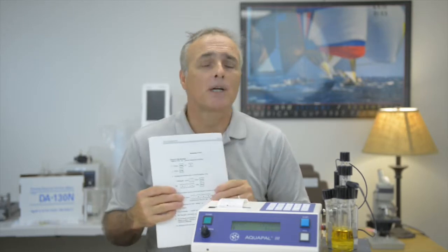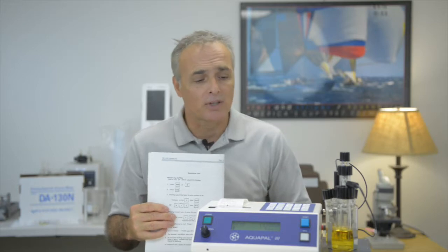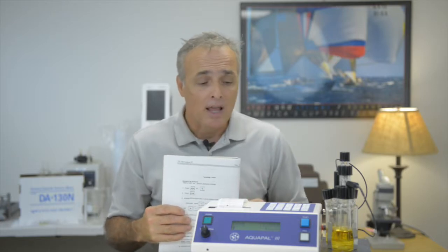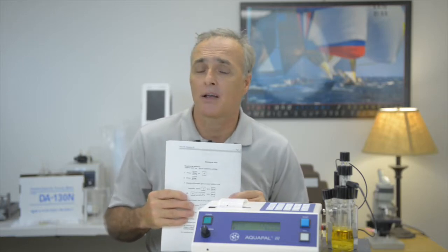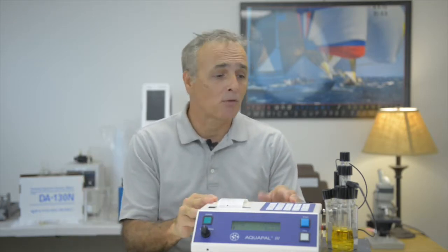I think one of the big questions that people have is, do we have to enter every time we run a test? Do we have to enter ppm or percent? And do we have to tell it its specific gravity? And do we have to put in the volume and so forth? What I'm going to show you today is a pro tip. You don't have to enter the data every time, and simply once you input that data into the Aquapal, you can then just come up and run a test every time by pressing the start button. So let's go ahead and do that.